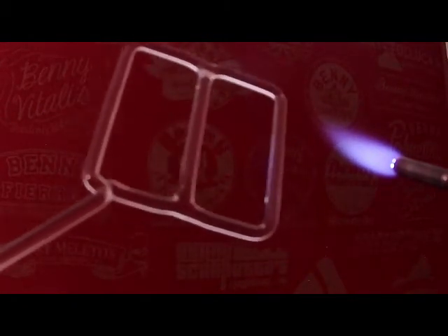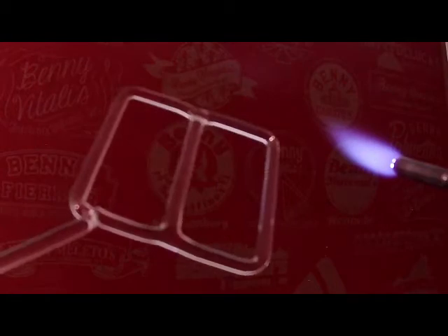So I've got this glass rod sealed on both ends. And if I make sure I'm still in focus, bring this a little closer, take a look at it. These welds look pretty good. Now, is there stress here? Of course. There's going to be stress throughout this entire thing.